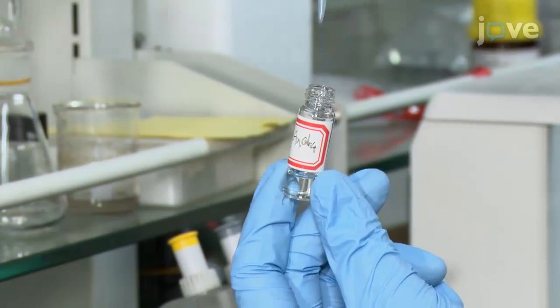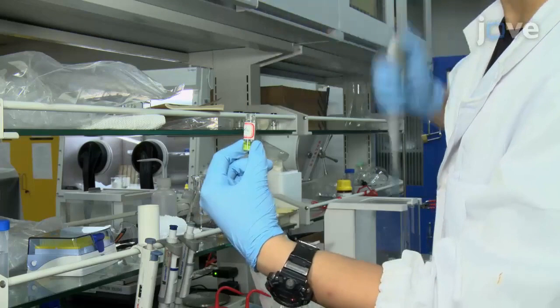First, in a 4 mL vial, dissolve 10 mg of hydrogen tetrachloroaurate-3 trihydrate in 1 mL of deionized water.